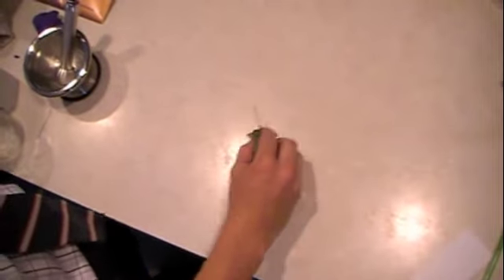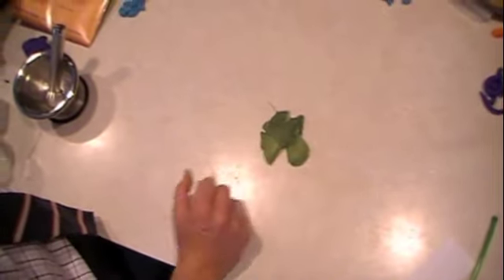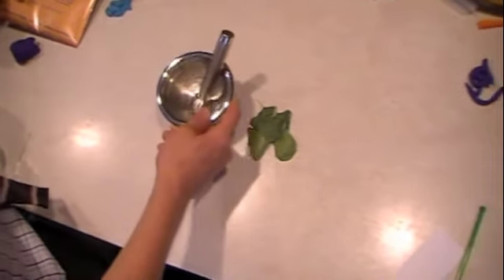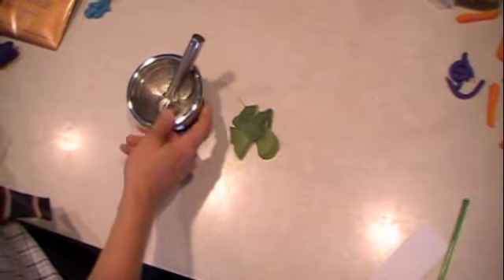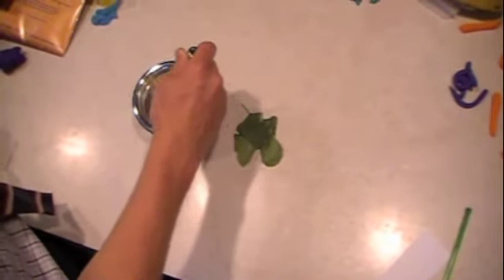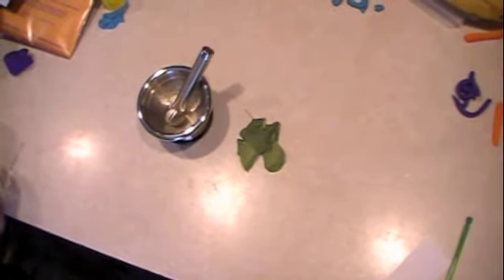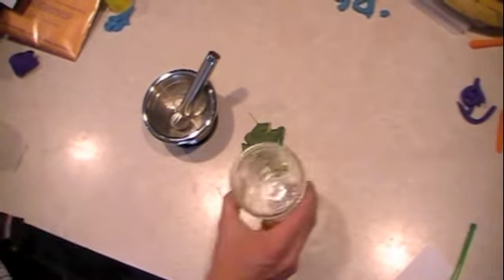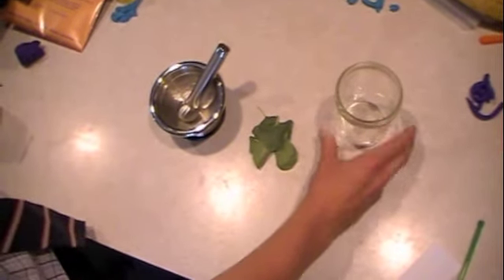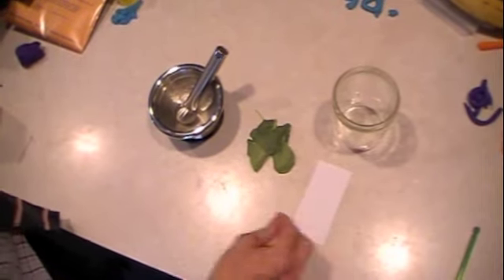In the lab Monday, we'll be using your leaf samples. You'll have a couple different kinds and a couple different colors. We will be using a mortar and pestle. This is a tool that we can use to grind up our leaves. Next, we will be using the jars that we used last week for chromatography. We will also be using chromatography paper.